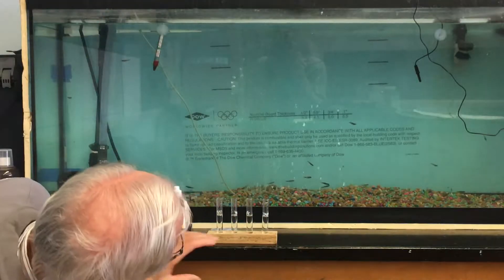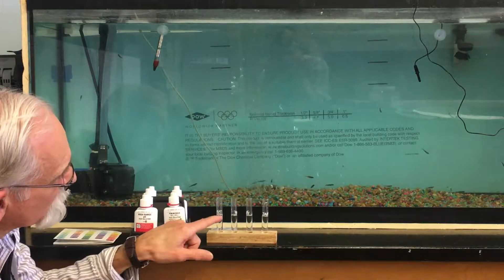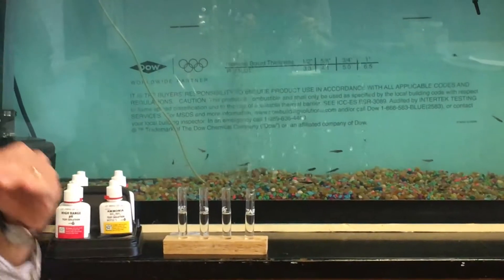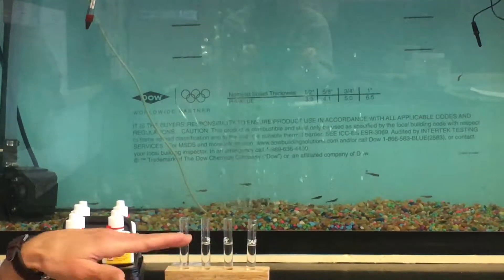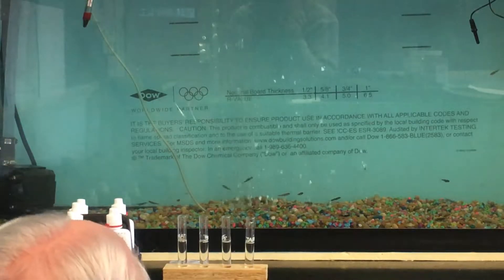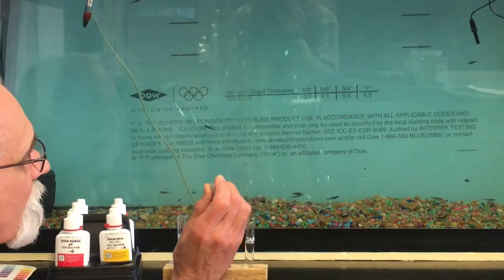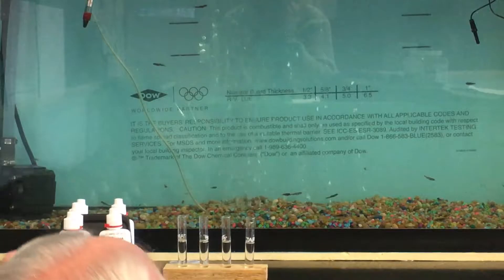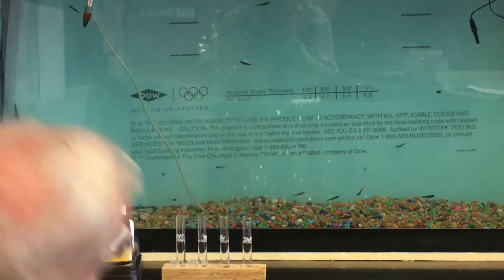What we're doing is getting the water up to the white line in the center of the test tube. Look carefully at the meniscus — the surface of the water has a slight curve to it. The low point of that meniscus should line up with the white line. Sometimes you need to add just a tiny drop to bring it to that level.